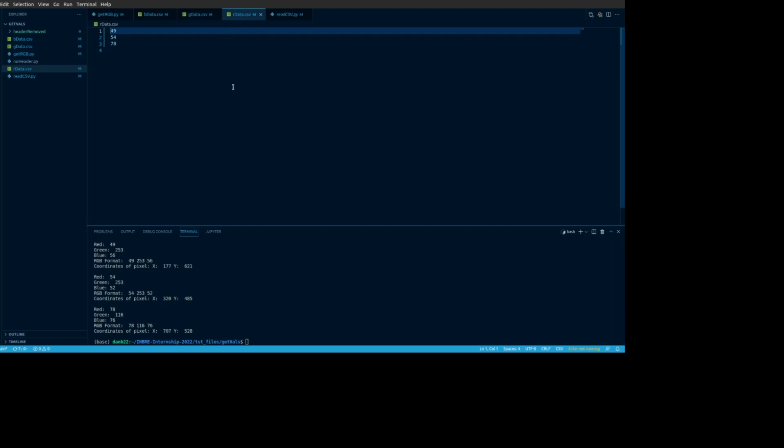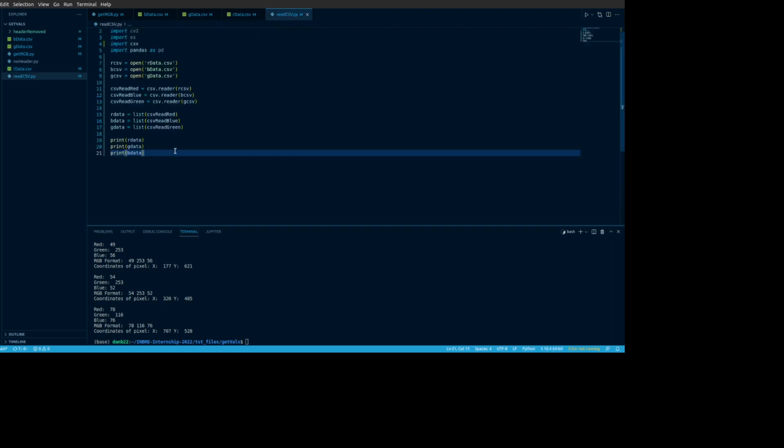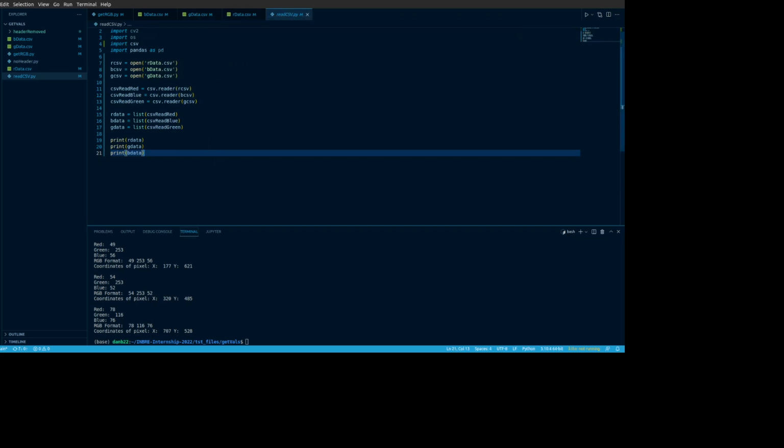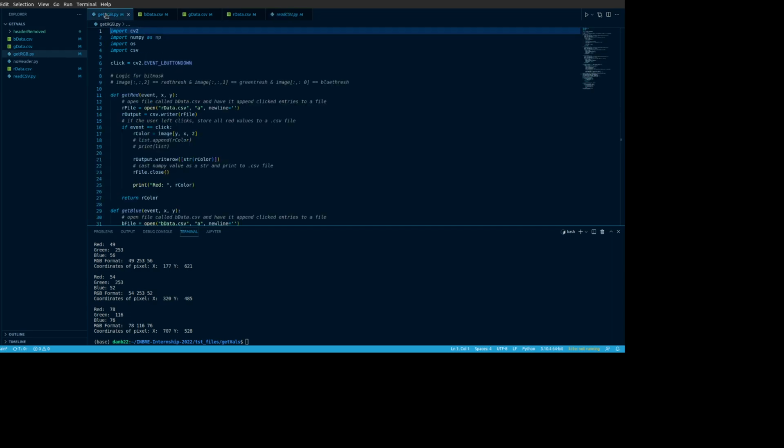This is important because I'm writing a read CSV program right now, which works. I've got it to work. The next thing is to take all the data it's going to read and store each value separately in a function so that we can average those values from that particular file. So that's kind of the next step. Apply a little statistical math to it and get a mean. Once that happens, we'll be able to take those variables and have an end calculation variable, rather. That's what I'm trying to say. Getting a little tongue-tied there.